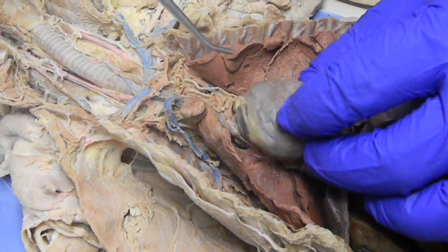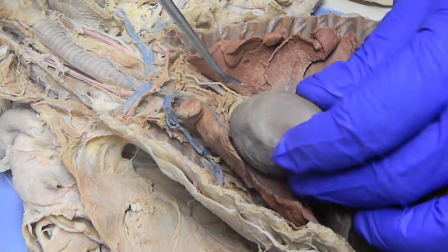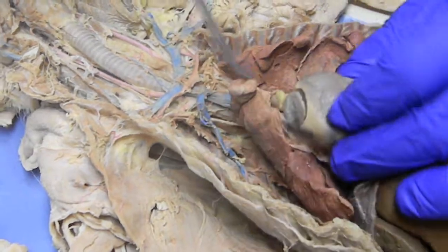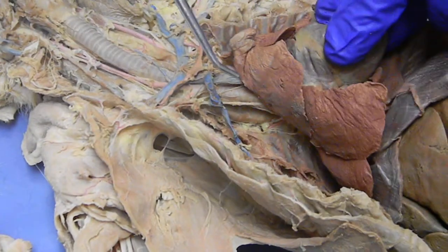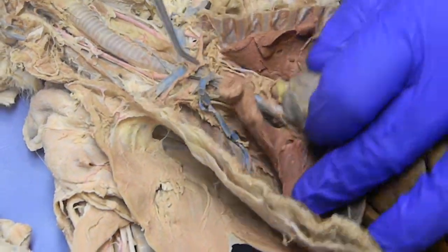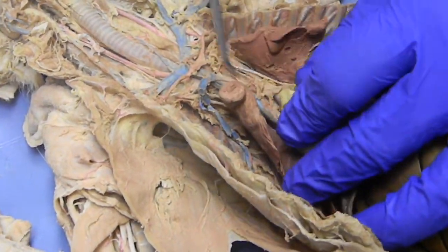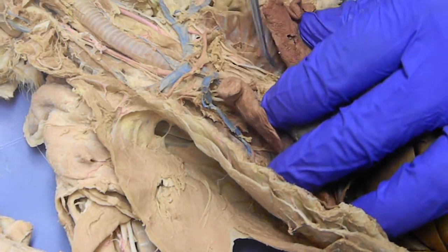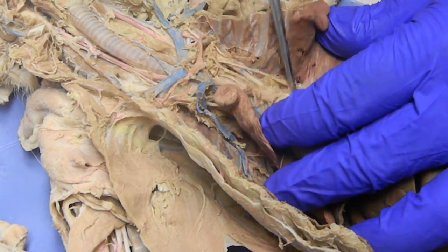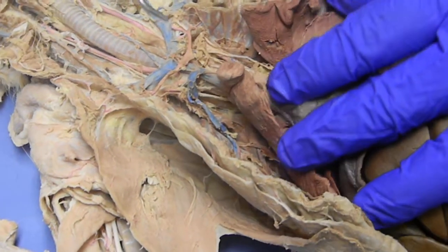The heart would sit in the pericardial sac, which again has been removed. And it's of course the heart. The trachea bifurcates into the primary bronchi, which is underneath all of this, which I'm not going to dig down to do.